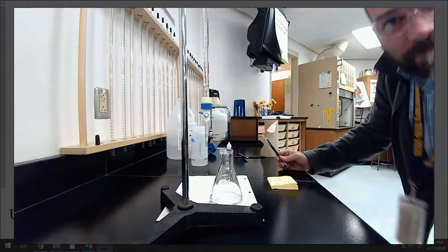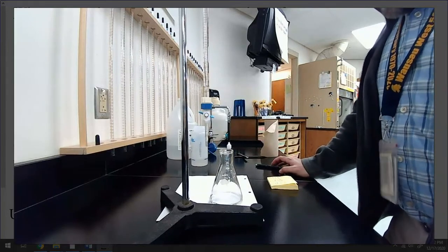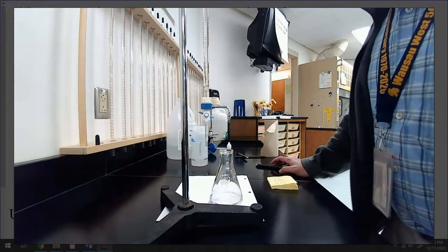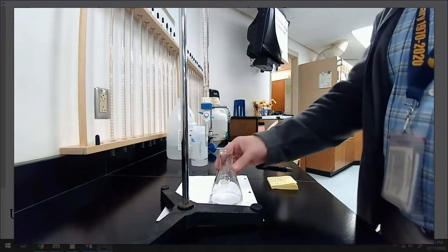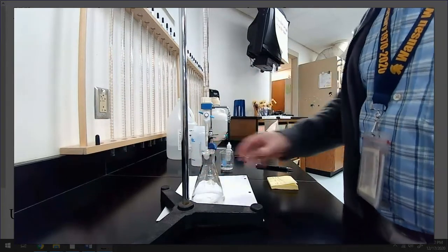So this one's taking more. Okay, that first one only took around 13 milliliters per trial. This one took about 20. So now I know when I refill it, I better have at least 20 milliliters left if I run a second trial of B. So let me get that set up. It looks like it turned back to colorless though. Hold on. Scratch that 49.08.